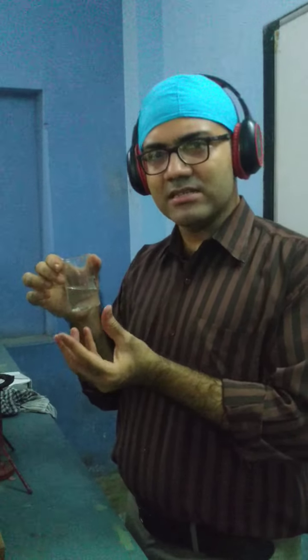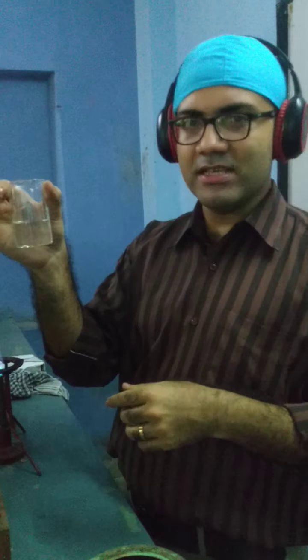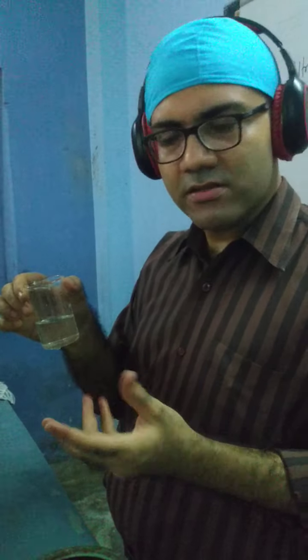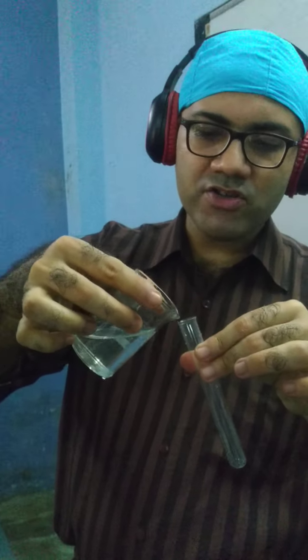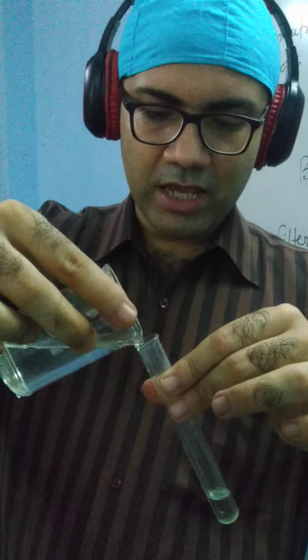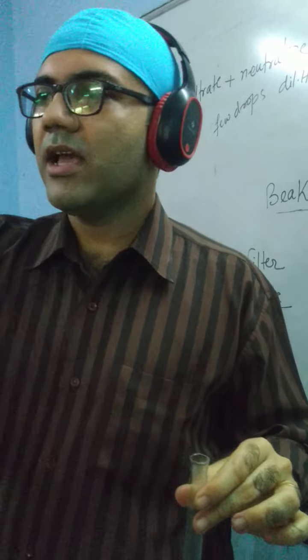Suppose if you boil but still you are having some sort of impurity, some solid substance, some precipitate, anything inside the mixture, you need to filter it out. But in this case, we are having a completely transparent solution. So nothing to filter. So we can easily, without filtering also, take a part of this liquid, because we are interested in the liquid. We'll take a part of this. I've taken this, and now we will add dilute nitric acid.